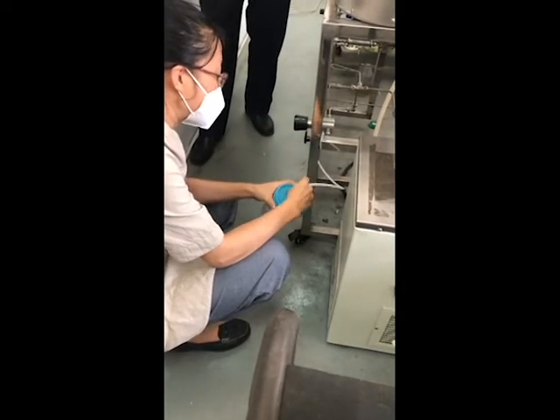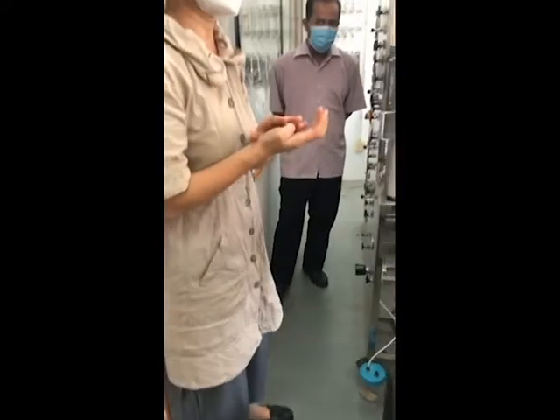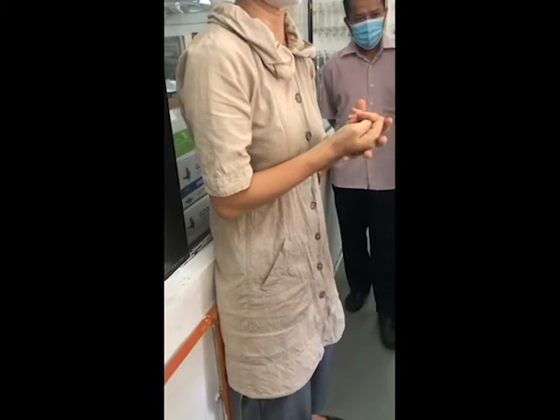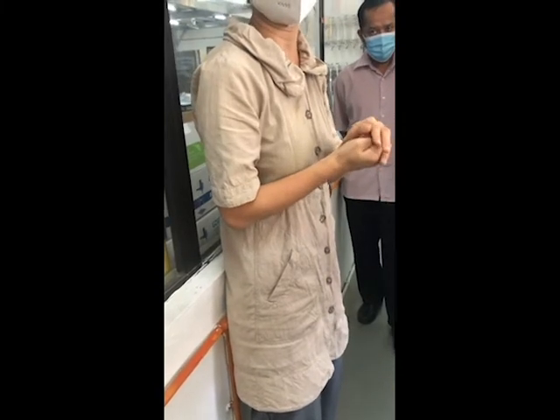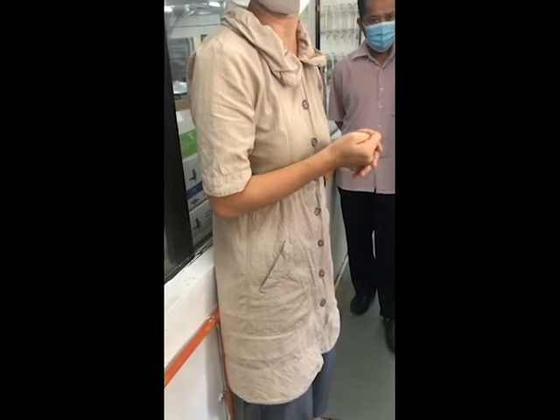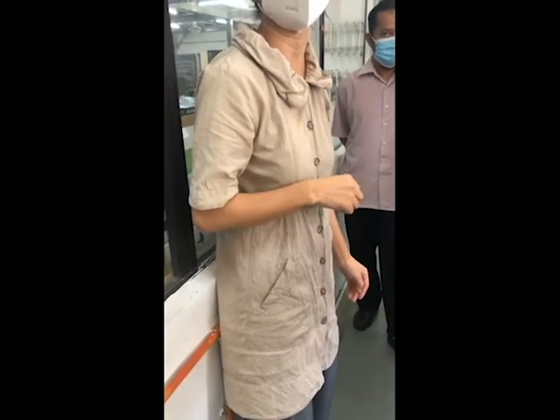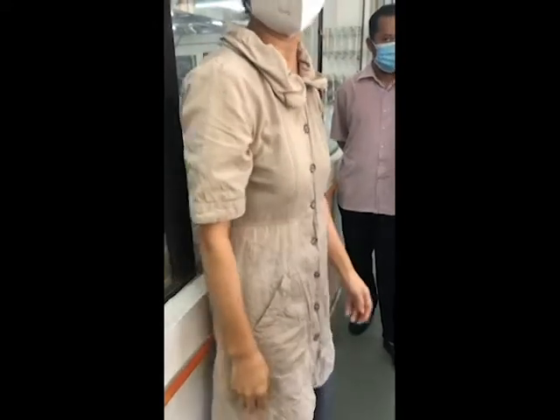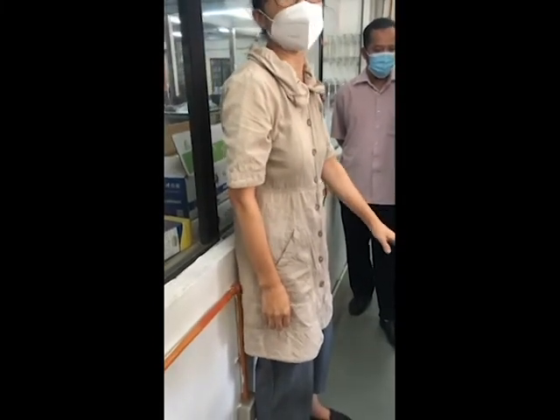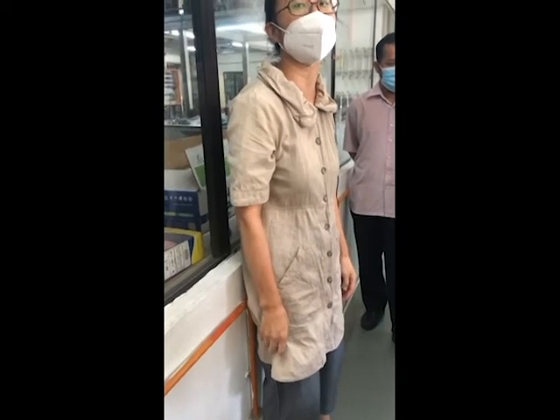Why sulfuric acid? We consider our gas emitting carbon dioxide, maybe carbon monoxide, nitrogen, hydrogen. You check whether they react with the sulfuric acid or not. If not, you can fill in here with sulfuric acid, which can dry the gas, like a drying process. But if the gas reacts with the sulfuric acid, you cannot use it because that will disturb your results.